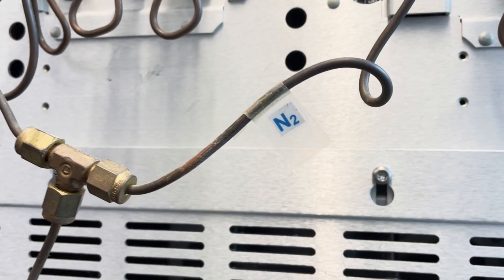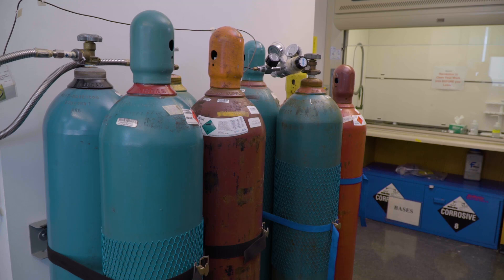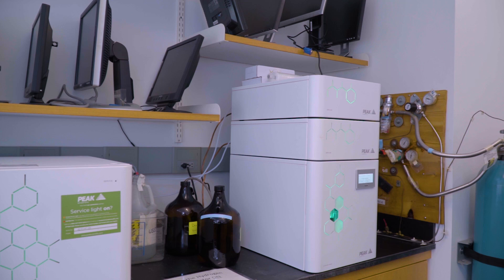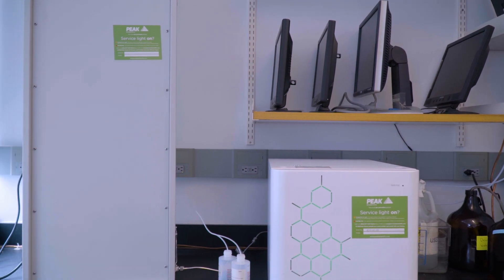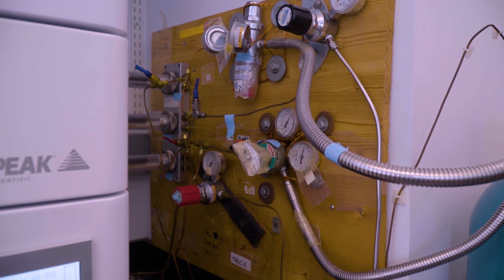The heart of a GCFID instrument lies in its major components. It all starts with the carrier gas, which can be nitrogen or helium — in this case, nitrogen. This gas can either come from a gas cylinder or an on-site nitrogen generator. The FID detector requires both air and hydrogen gas, which are carefully regulated. To ensure high purity gas, we have an online gas purification trap to capture trace impurities and moisture.